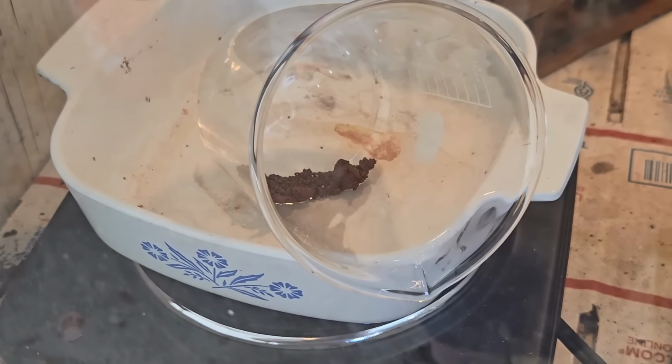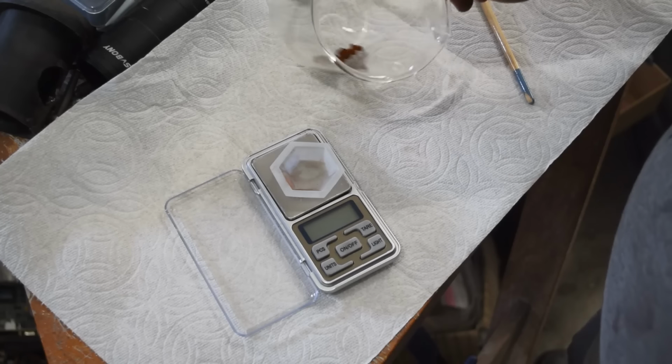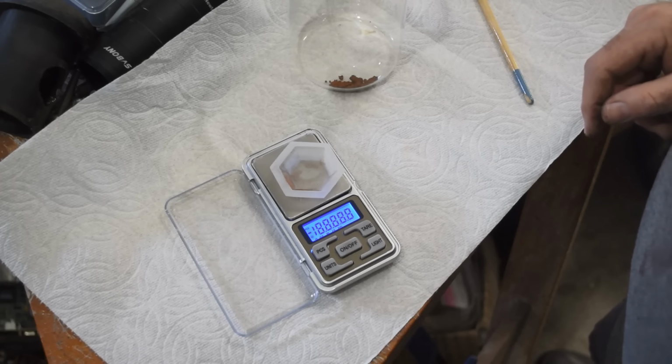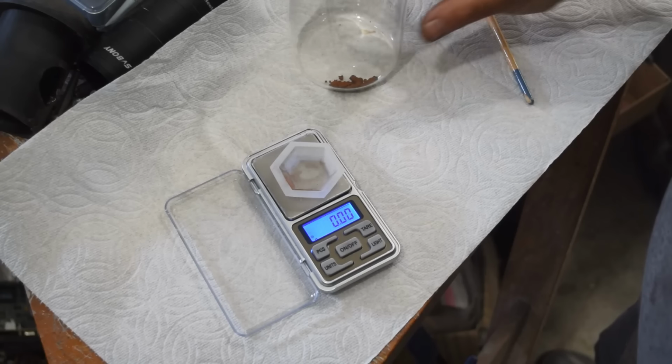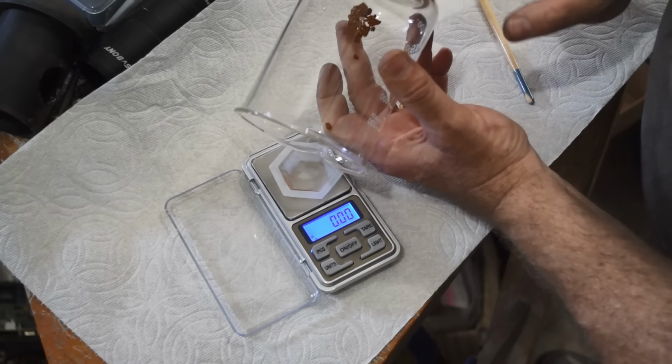Calculate a yield. Alright, so here's the gold I recovered. So let's give it a weight. See what we've got here. This is good looking stuff, by the way.